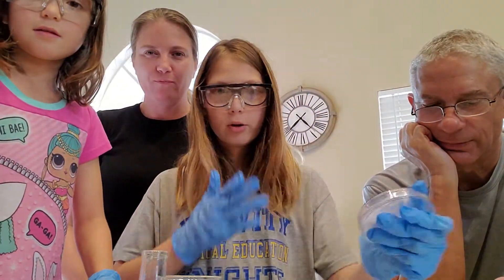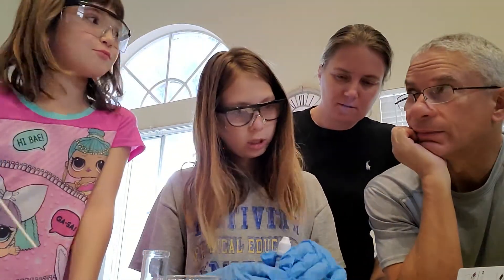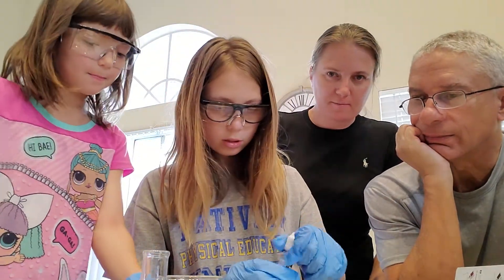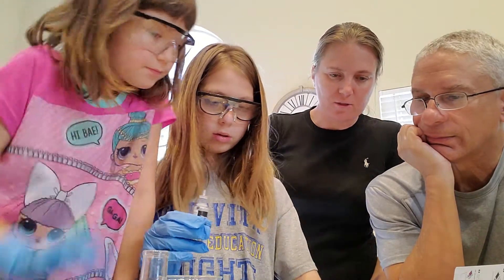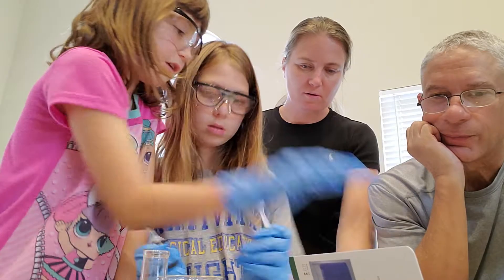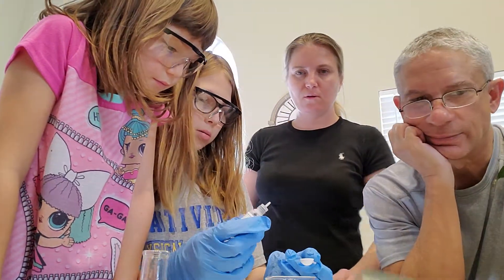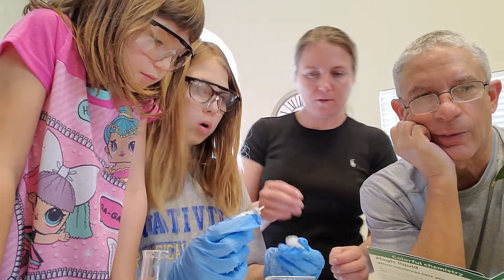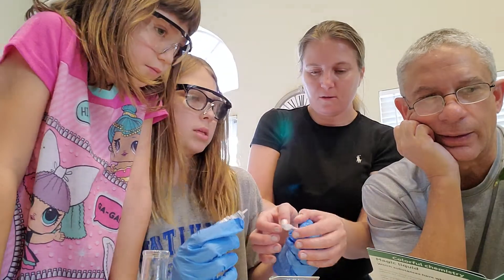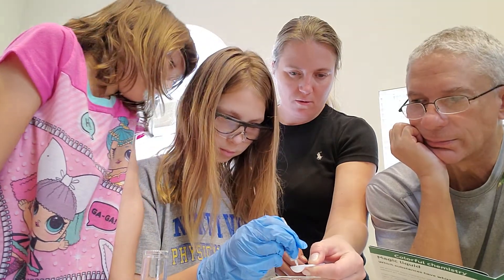He's actually kidnapping us right now. Okay, Mama, you could put in one big spoon. You're the one that reads instructions, right? Put them here in case anything spills. You could do one big spoon. Hold the spoon. We need to first prepare the solution. One big spoon — spoon of what? This is awkward.